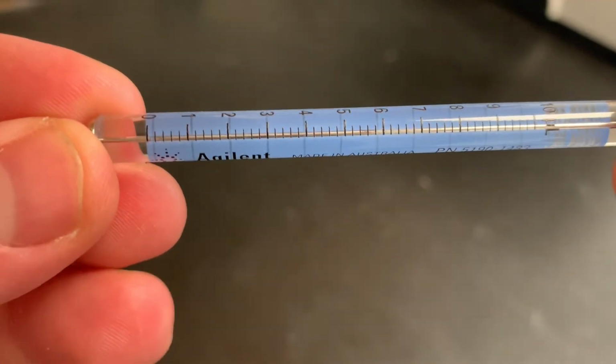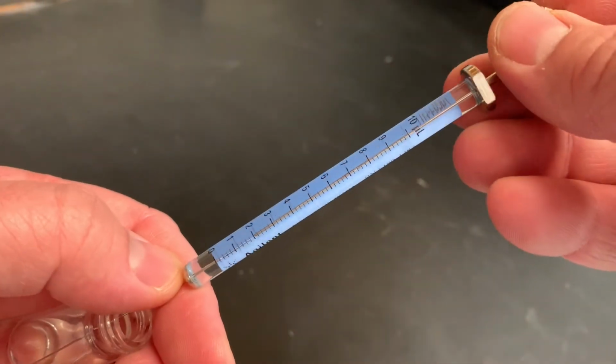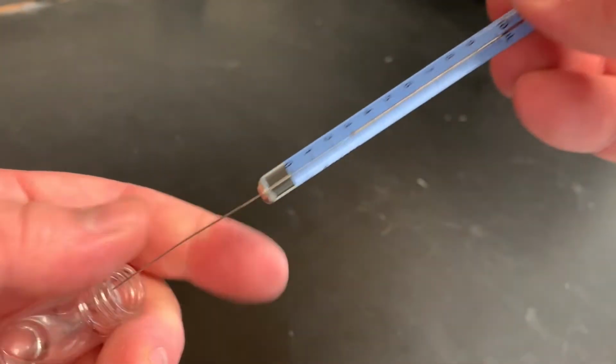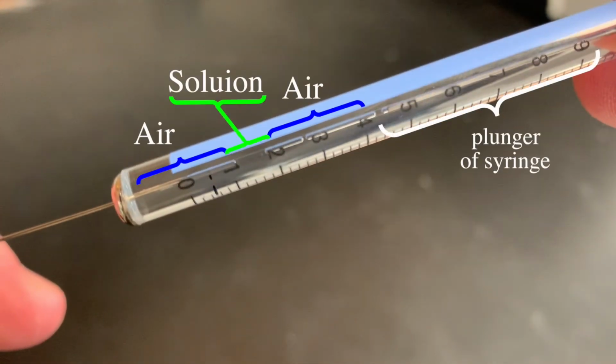Now you're going to need 1 microliter. To do this, you first want to suck up a little bit of air, about 2 microliters, then 1 microliter of your dilute sample, and then another 2 microliters of air. In the end, it should look something like this. Air, solution, air. To run the GC, hit prep run.